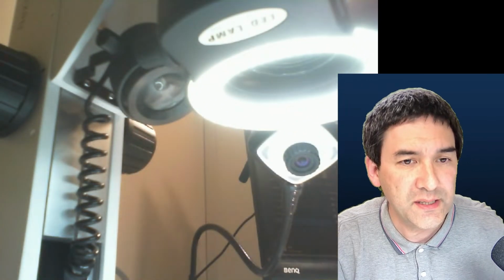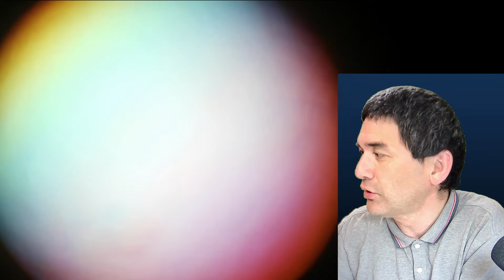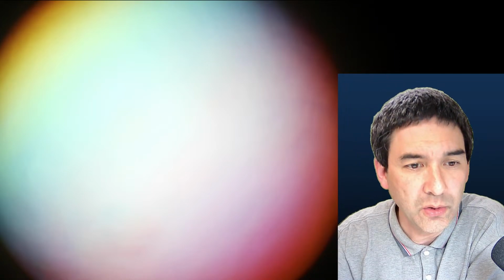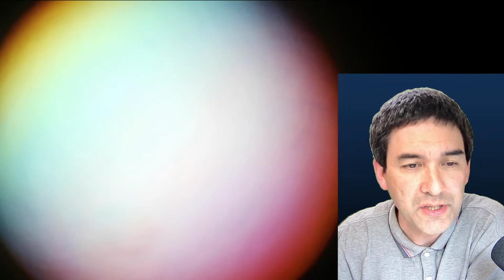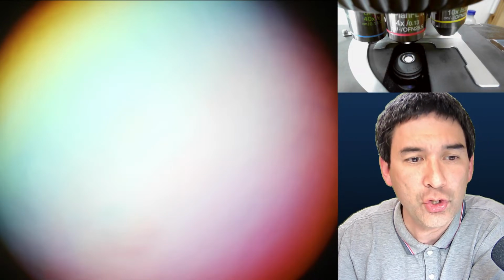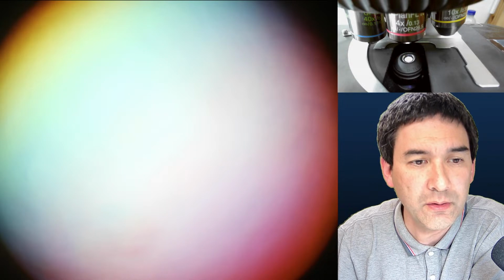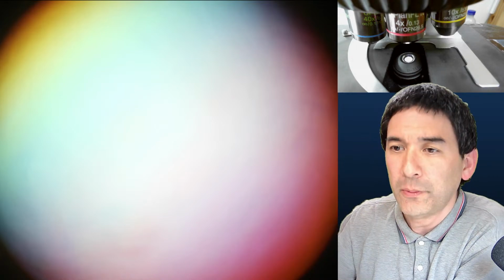This is also the reason why I readjusted the screens a little bit. So that's now the other camera. And I just see that the stage at the top is not showing. That's a pity, because I actually wanted. Yes, here we go. Here it is. Okay, so that's the stage showing. Let me quickly move this up as well. So now you can actually see what's happening on the other microscope.